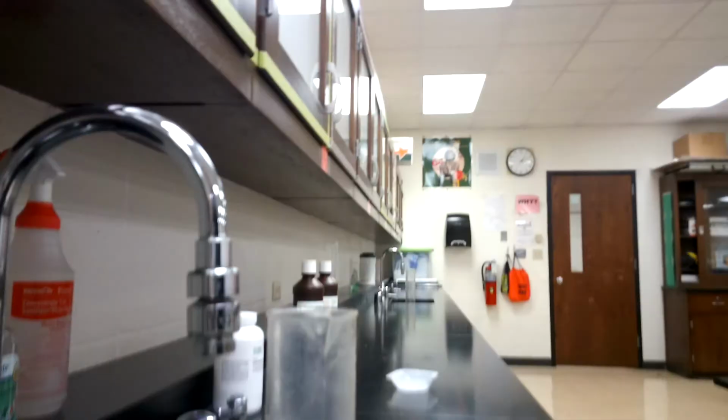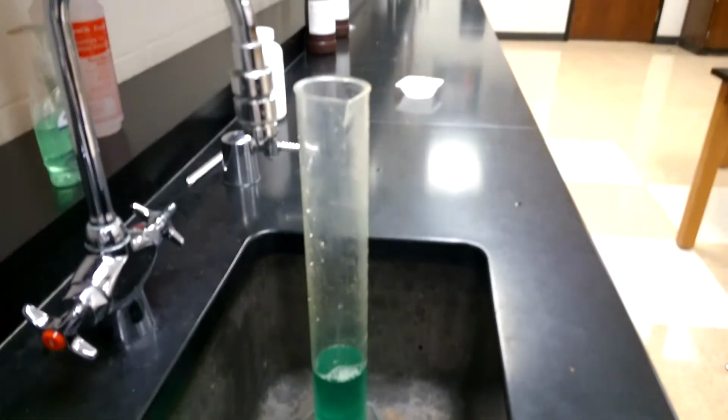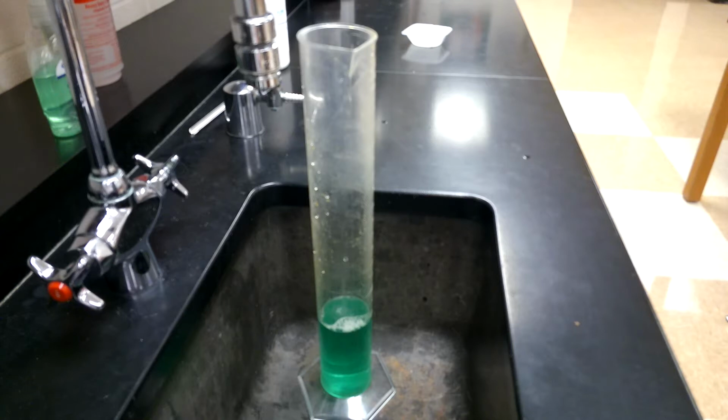Okay, here's another cool demo for you. Hopefully you've seen this one before or heard of it. I found that most students have. This one's called the elephant toothpaste demo. You've probably seen it, all sorts of craziness on YouTube and stuff. I think I shared a cool video with it already, but I wanted to show you it from a how do we change reaction rates perspective.